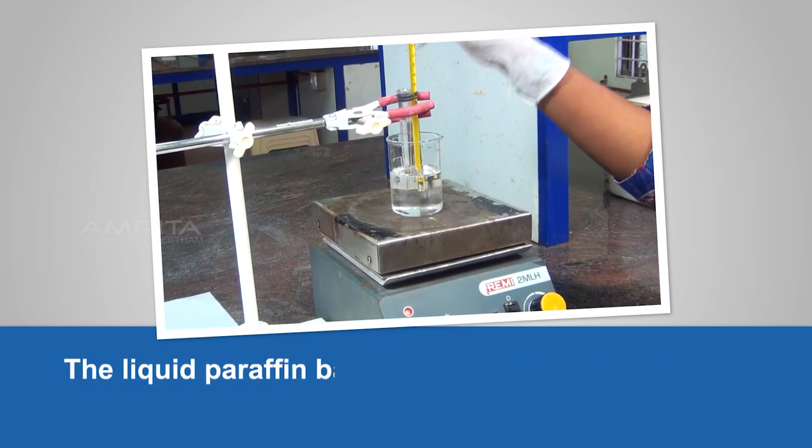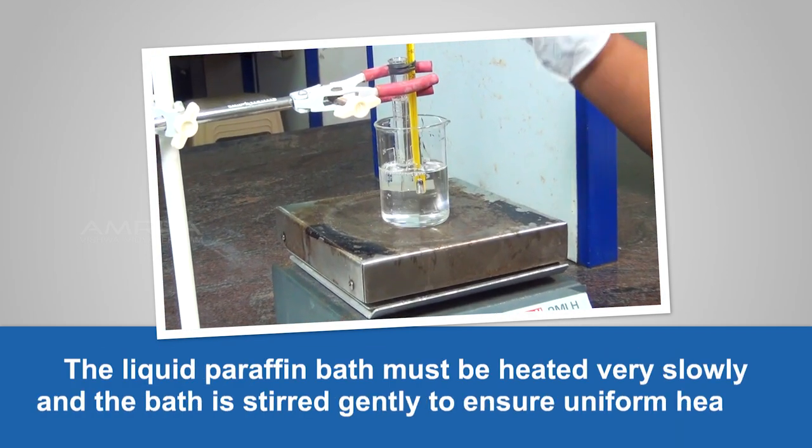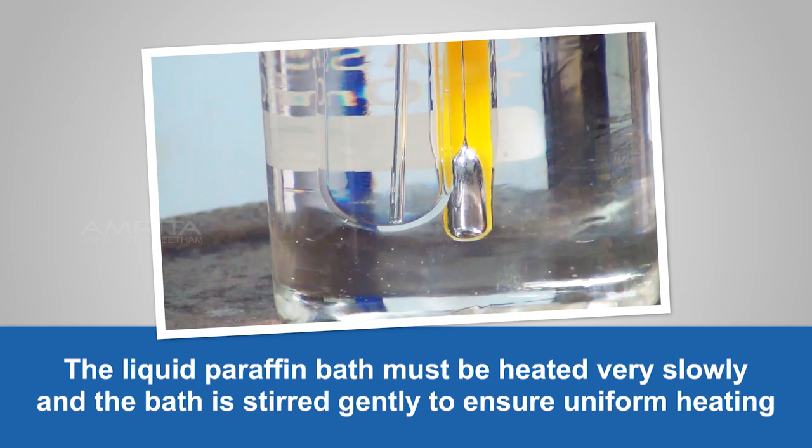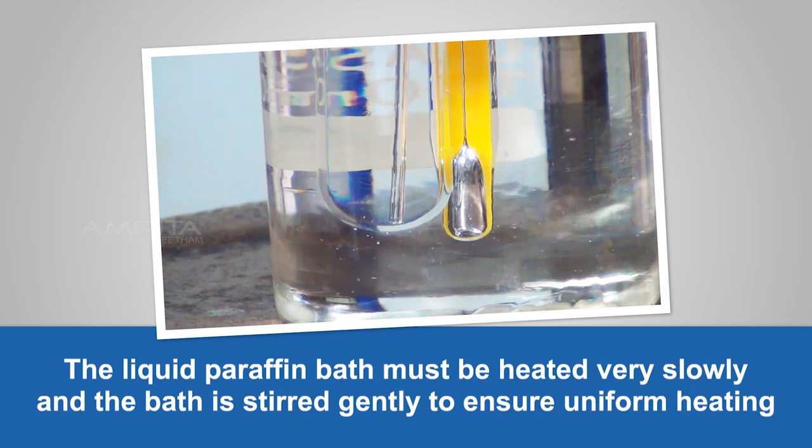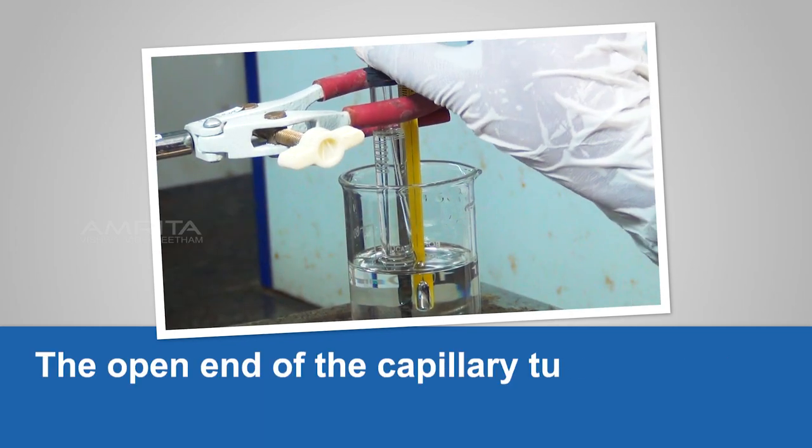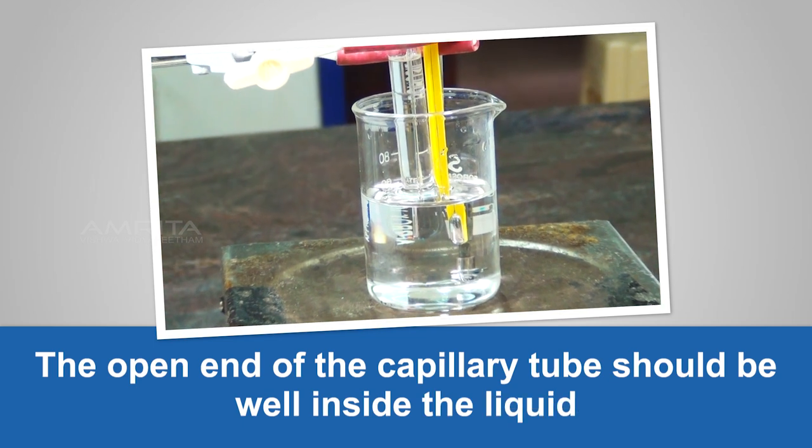The liquid paraffin bath must be heated very slowly and the bath is stirred gently to ensure uniform heating. The open end of the capillary tube should be well inside the liquid.